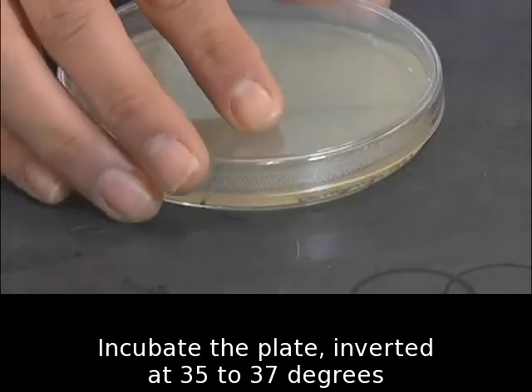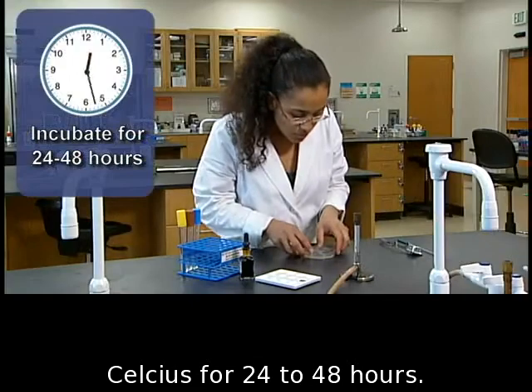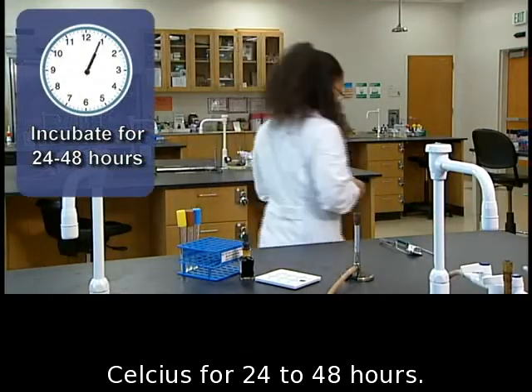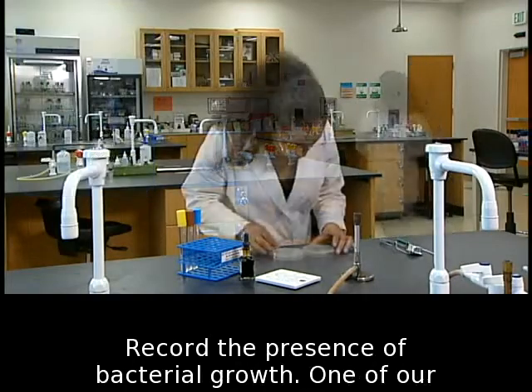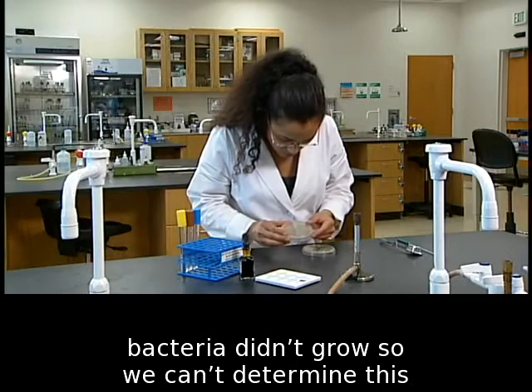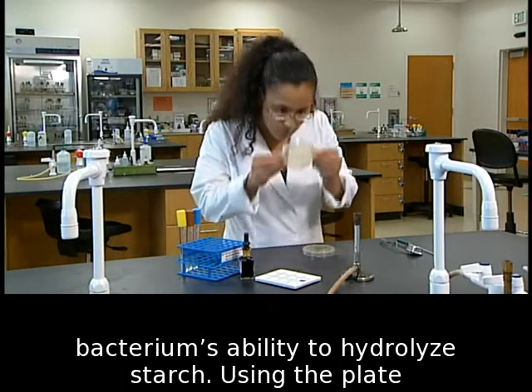Incubate the plate, inverted, at 35 to 37 degrees Celsius for 24 to 48 hours. Record the presence of bacterial growth. One of our bacteria didn't grow, so we can't determine this bacterium's ability to hydrolyze starch.